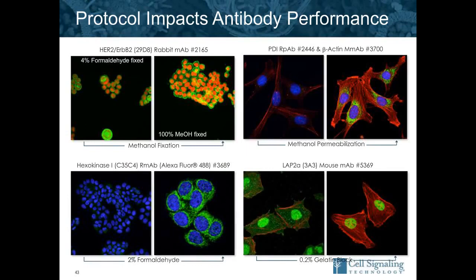This last slide on protocol looks at a bunch of different tweaks. So whether you're going to methanol fix or methanol perm on the upper right, decreasing the formaldehyde concentration, or even changing the blocking solution, all of these can have a dramatic impact on the antibody performance. As Anthony mentioned, it's always best to go with the vendor-supplied protocol first and make sure everything's working, and then you can do your tweaks after.